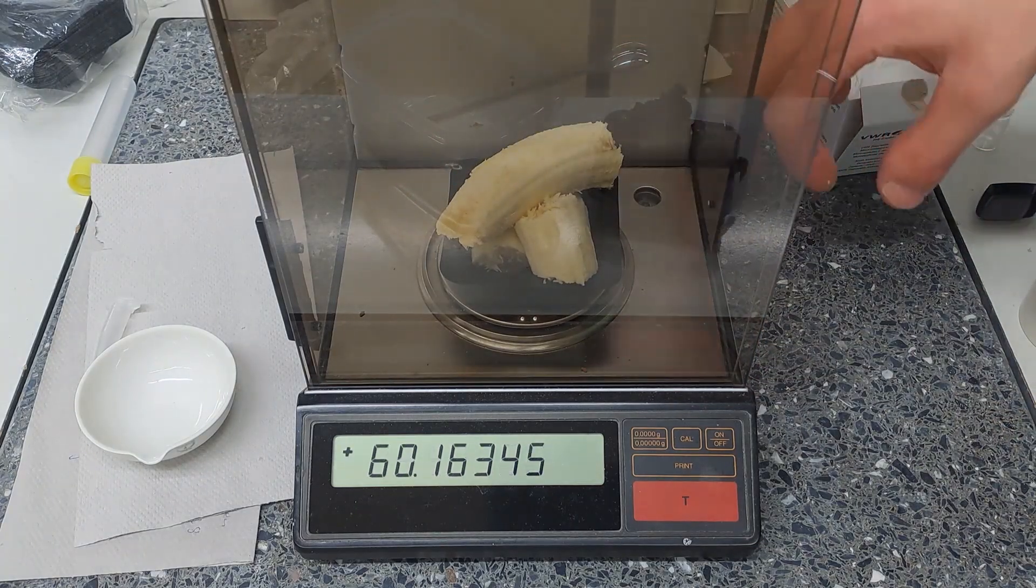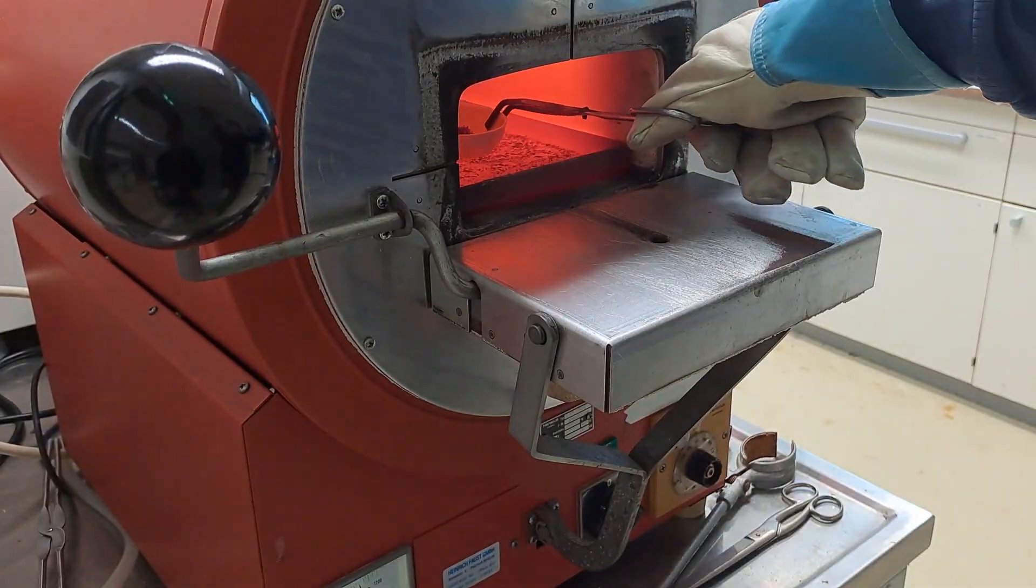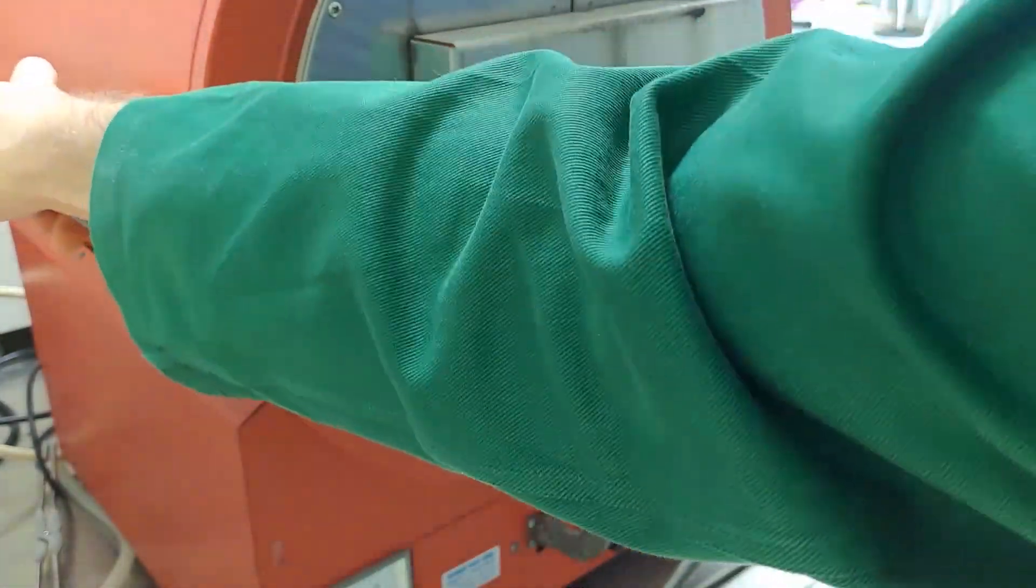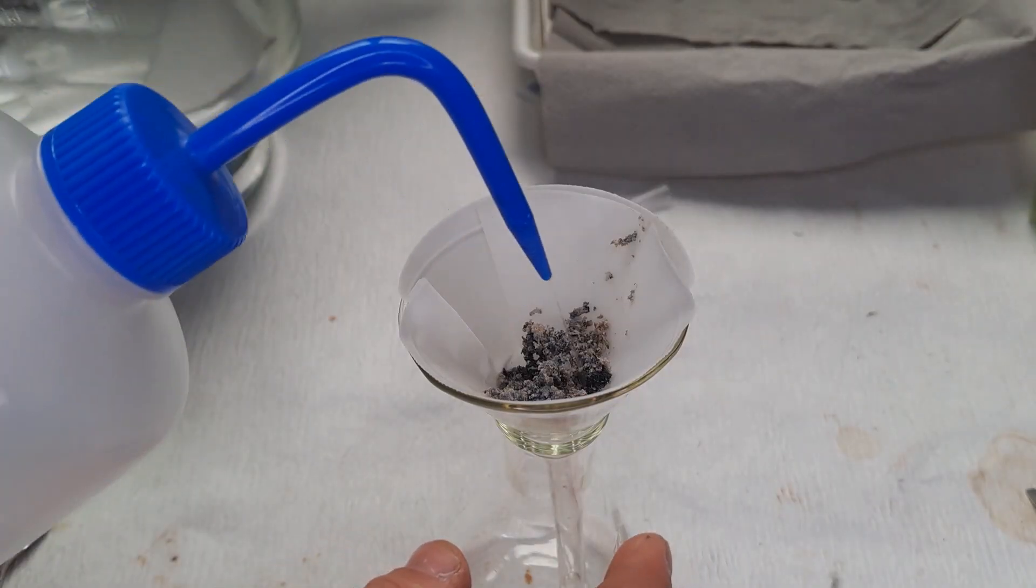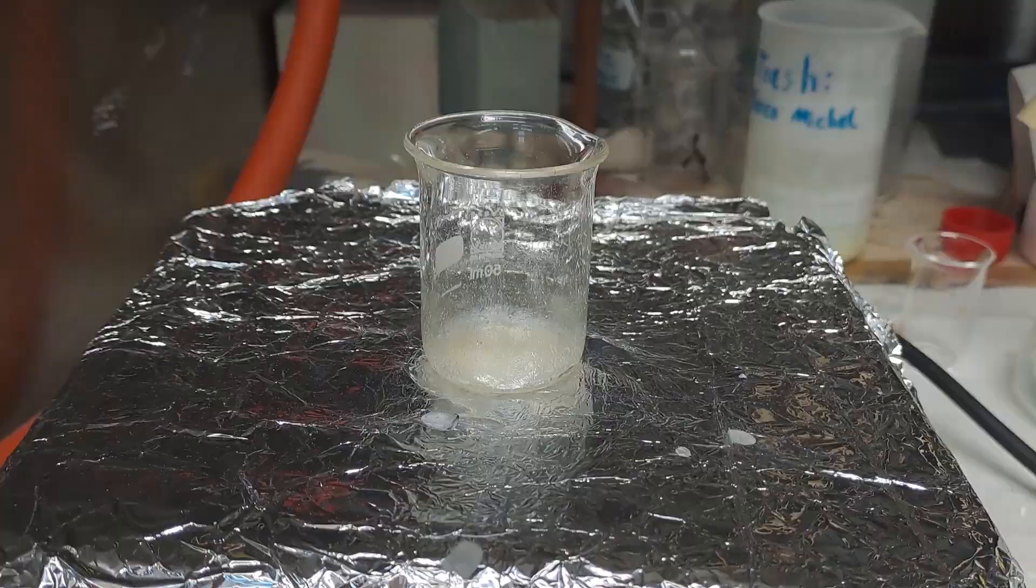In the last video, I promised you a little follow-up. Quick summary: I got potassium-40 and cesium-137 out of bananas by drying and incinerating them. After filtering the washings from the ash and letting it dry up, we got a white crystalline solid made from alkali carbonates.